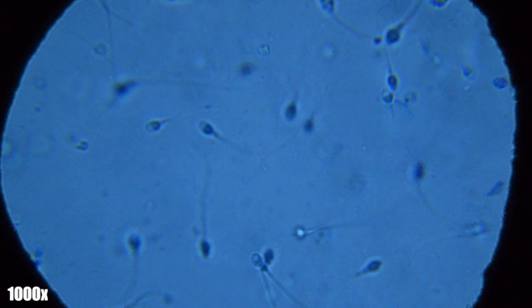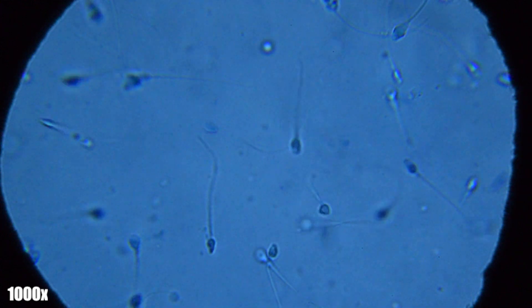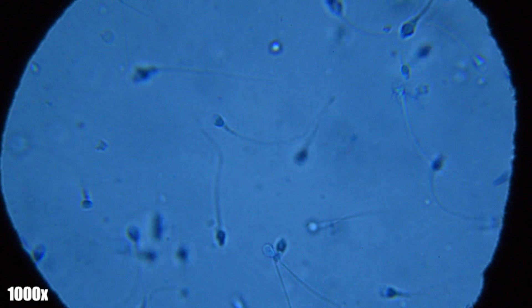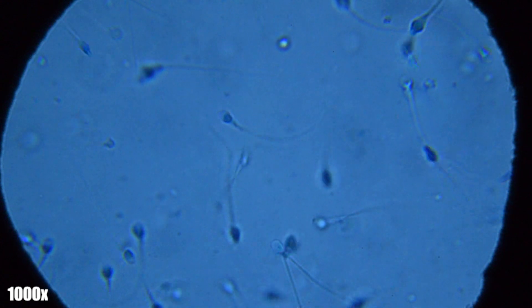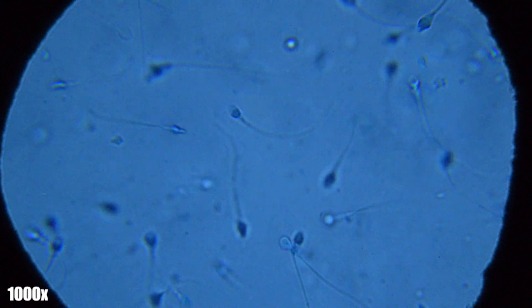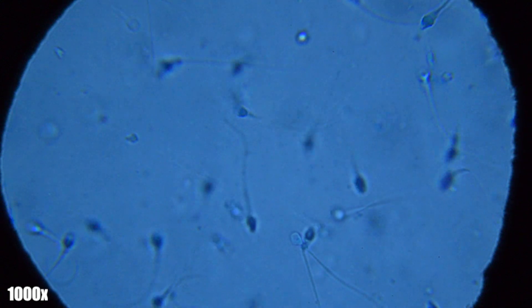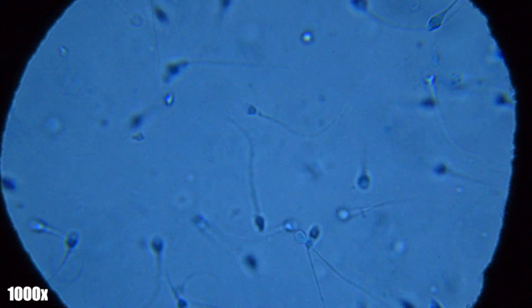Because these sperm were kind of hard to visualize when they were moving so fast, I decided to go ahead and humanely stop their movement by adding some ethanol to them. That's going to be coming up pretty quick.